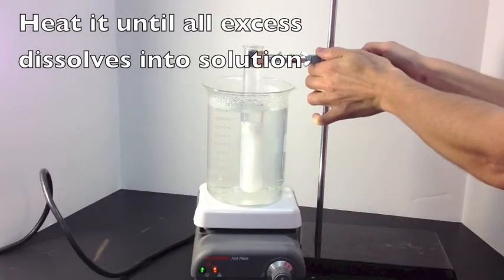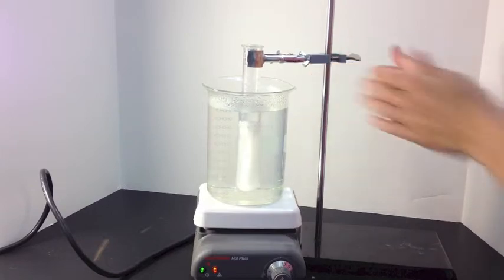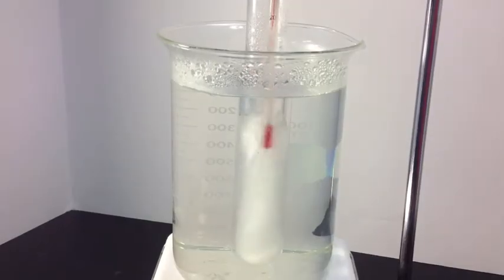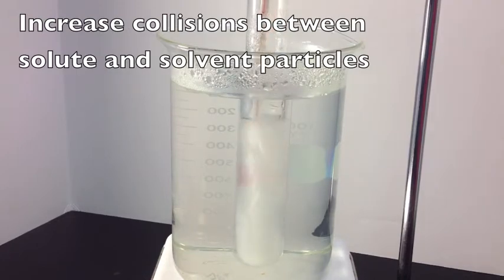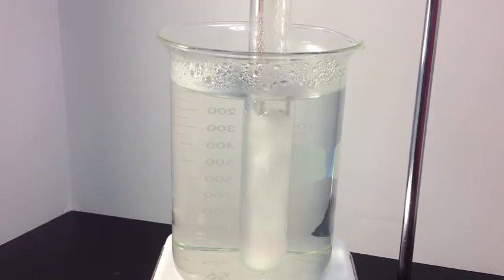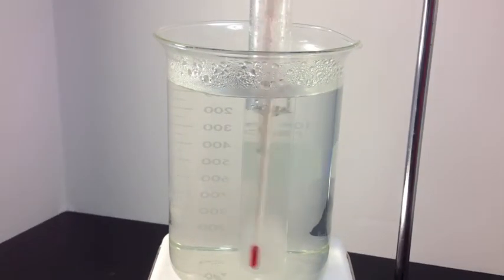So here we are, lowering the test tube into the hot water bath. We're going to stir it, make those solute particles collide with the solvent, make more collisions so it'll dissolve a little bit faster. Eventually all of it will dissolve.